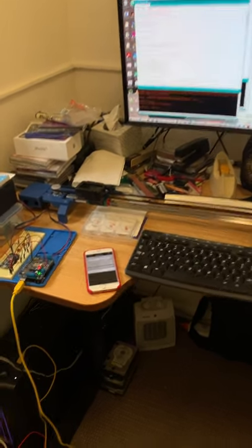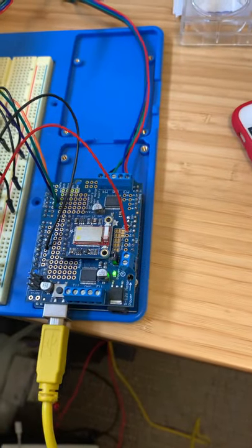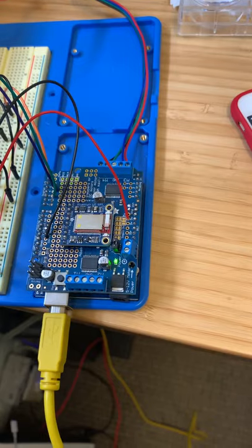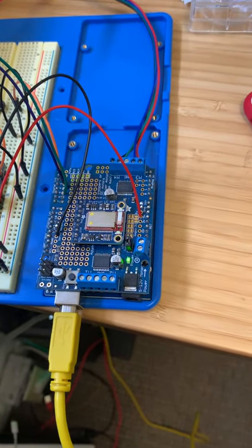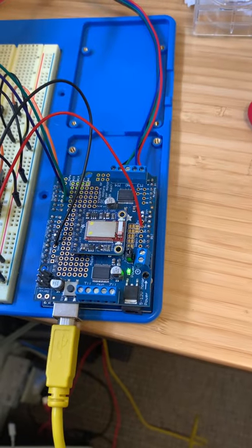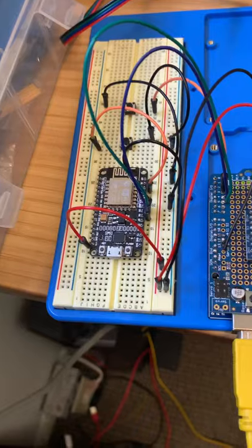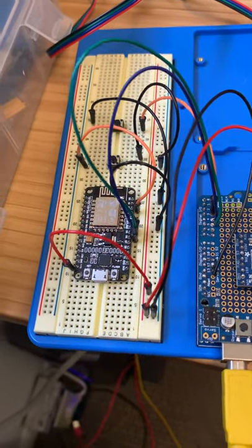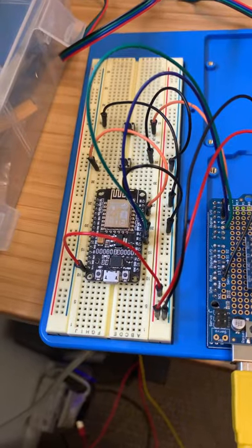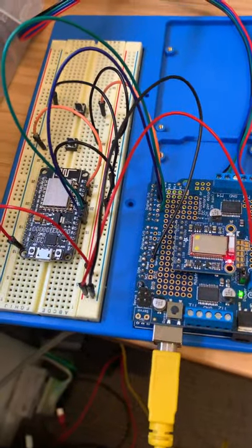So what we have here is the hardware, which is an Uno, and it's got a shield on it to talk to the stepper motor, and another shield to talk to Bluetooth, which is where we're going to get commands from a phone, a smartphone. Over here we have the Wi-Fi interface, an ESP8266, which is going to talk to the GoPro. So these two machines are connected together with a serial interface.